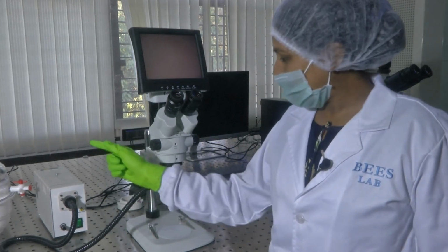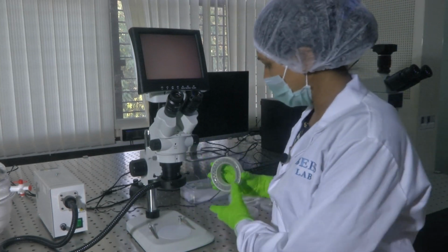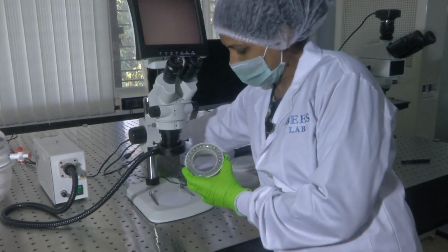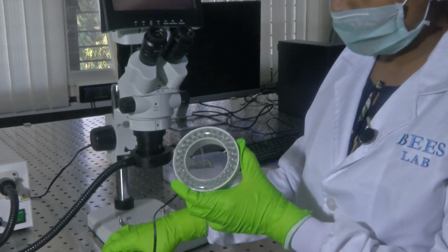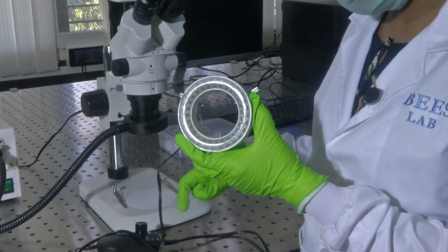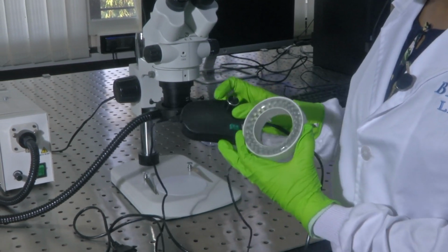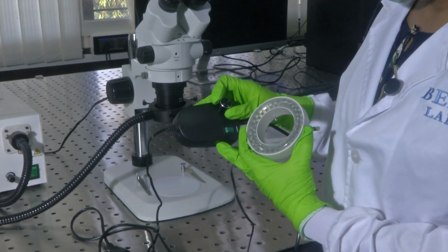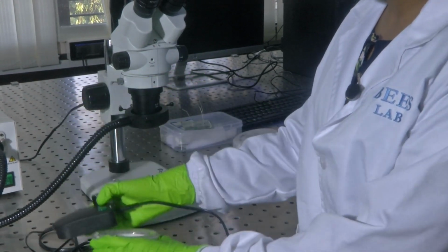Then we also have another light source, an alternative to the current one, which is connected to the device, and this is the LED based light source. The LED strip along the source illuminates the sample under examination, and here the intensity of the light source could be varied using the knob. This is one additional feature which has come with the microscope we have.